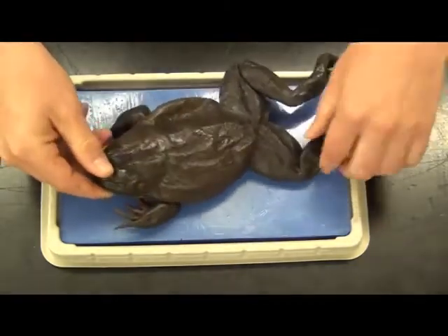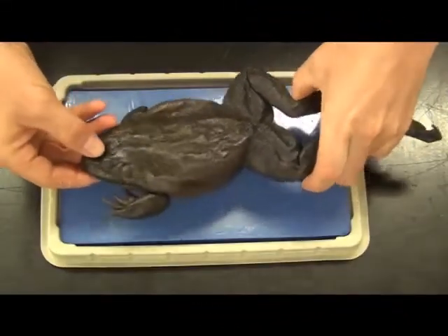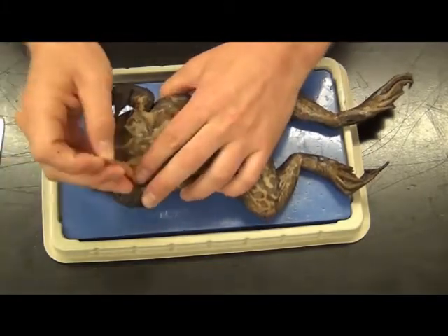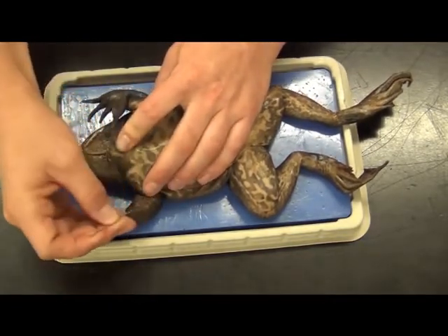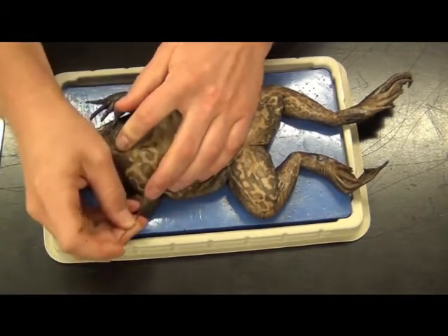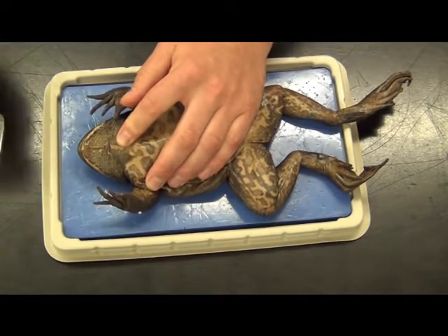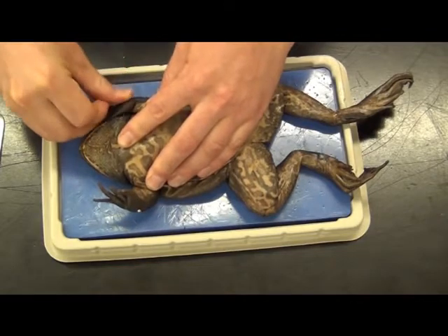Let's go ahead and open up the mouth now. What I usually instruct my students to do is go ahead and pin the arms and legs. You will have either T-pins or needles that will work for this. Sometimes you'll actually have to break the arms — it's a gruesome thing, not a fun thing, but it's a necessary thing when it comes to dissections. Whenever you put needles in, make sure you put them in at an angle. Go in through the arm as far as you can, at an angle if possible, and hopefully that will keep the arm out of the way and keep the frog from moving around on the plate.